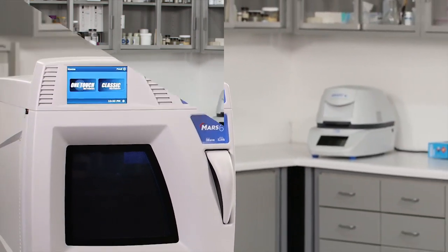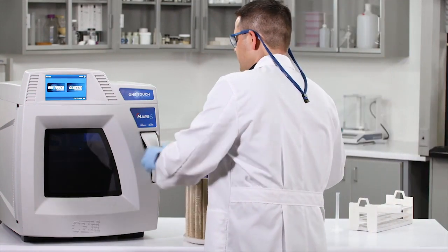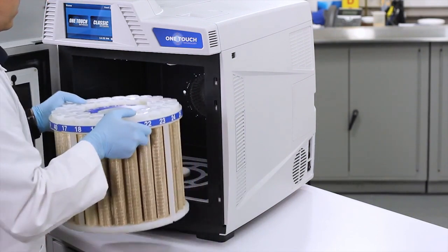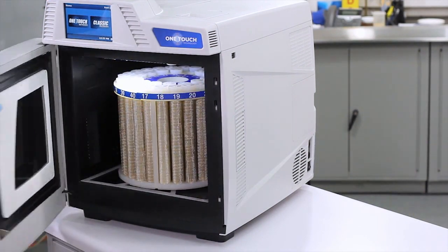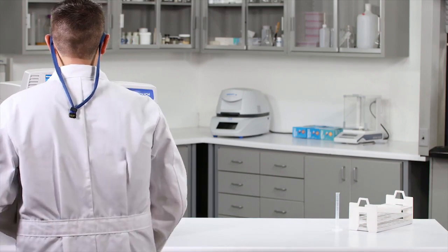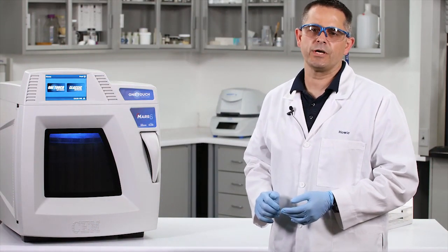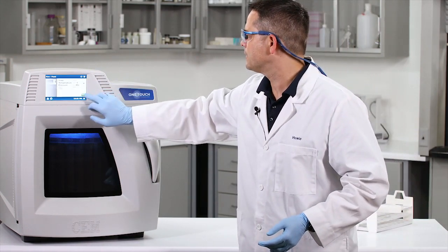Now it's time to head to the microwave. Now that everything's loaded, we simply select our Food One-Touch method, press Start, set it and forget it. While our samples are digesting, let's see what the worldwide web has to say about the history of peanut butter.